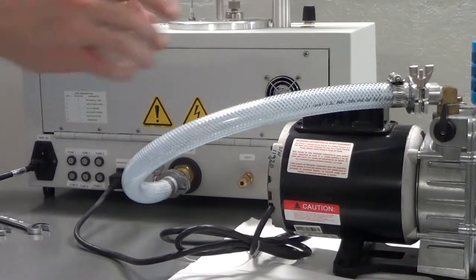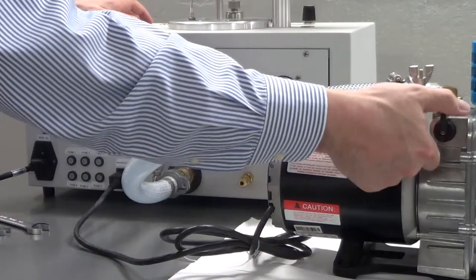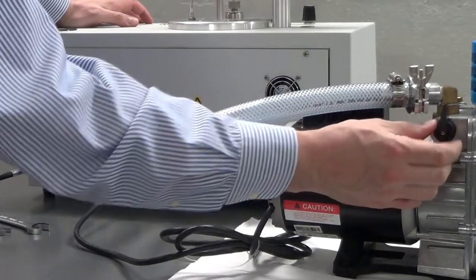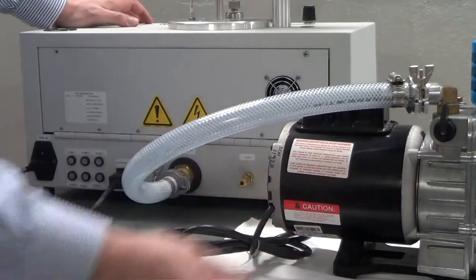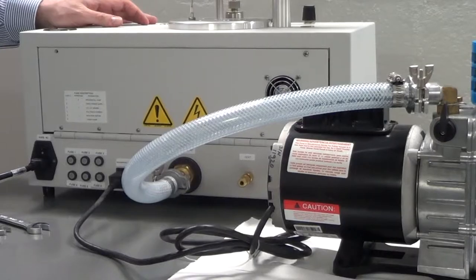Before you power on the unit, make sure that the valve of the pump is facing the up position as shown. It ships with the valve in the closed position, horizontal, so ensure that the valve is open, vertical, before starting the system.